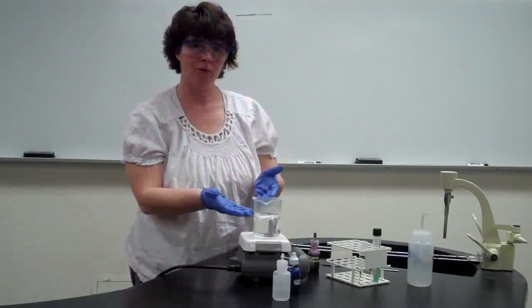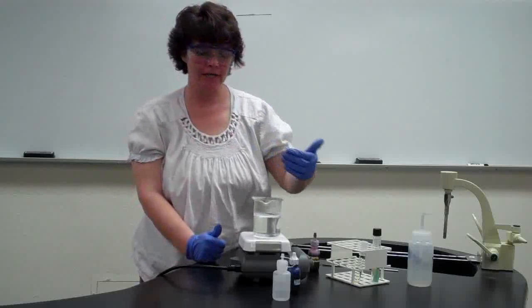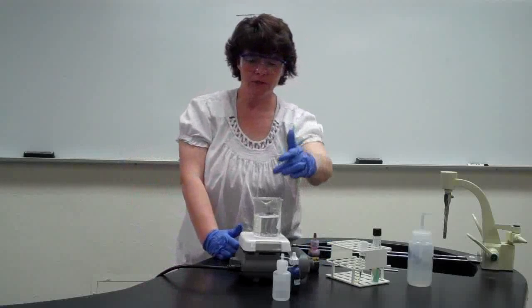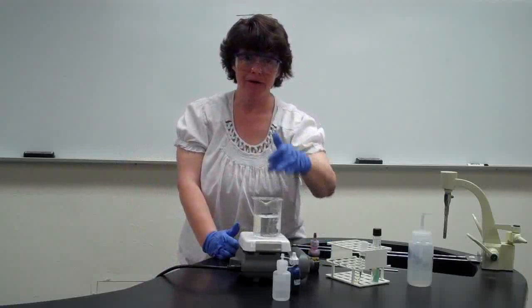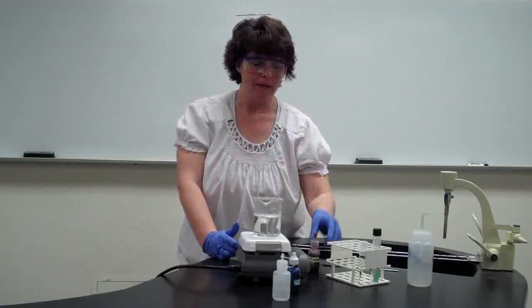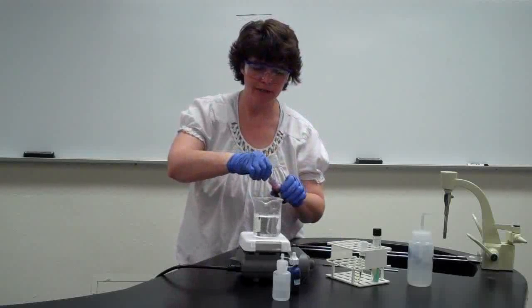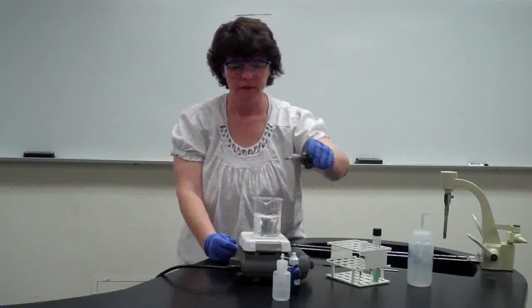The key is to just be very careful and not to burn yourself or knock the slides into the water. Our goal is not to make the water change color. Our goal is for the slide itself, for the stain to penetrate. So what you're going to do, you put the slide up here after you fix the smear, but before you put the stain on. So now you're going to add the stain, and you're just going to flood it like you've done with previous labs.